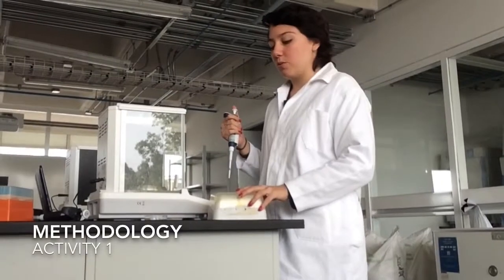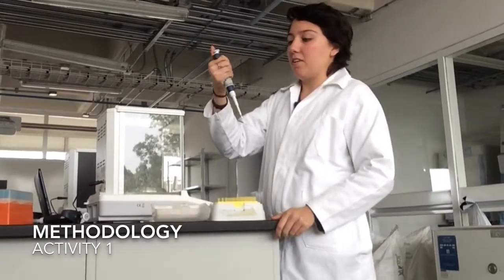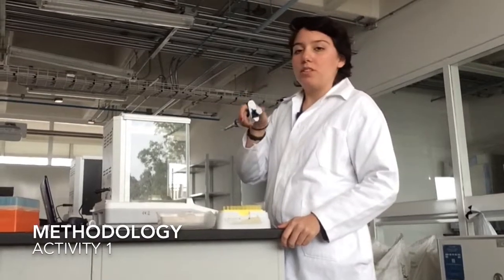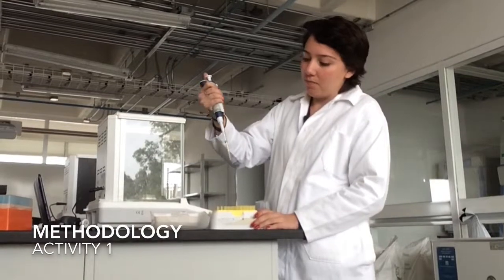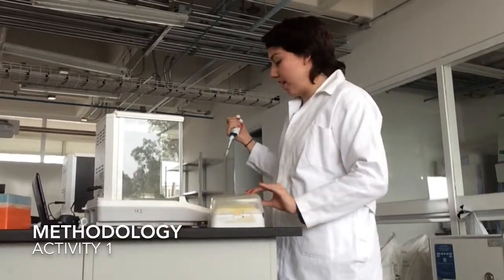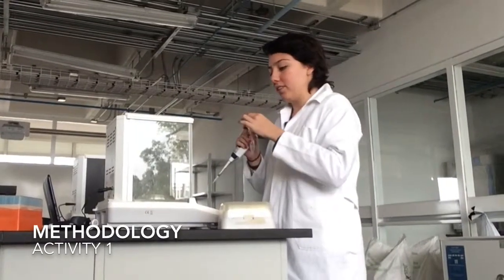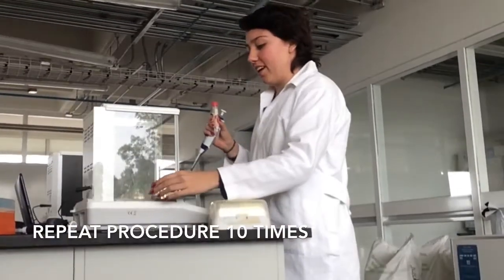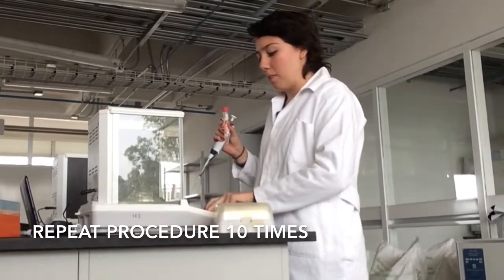Hi, so we're going to start with the first activity. We take our micropipette. This micropipette is of 20 microliters. So we take the tip, and then we have our conic tube with water. We open it. But first we open our scale. We set the scale to 0 when it's done.